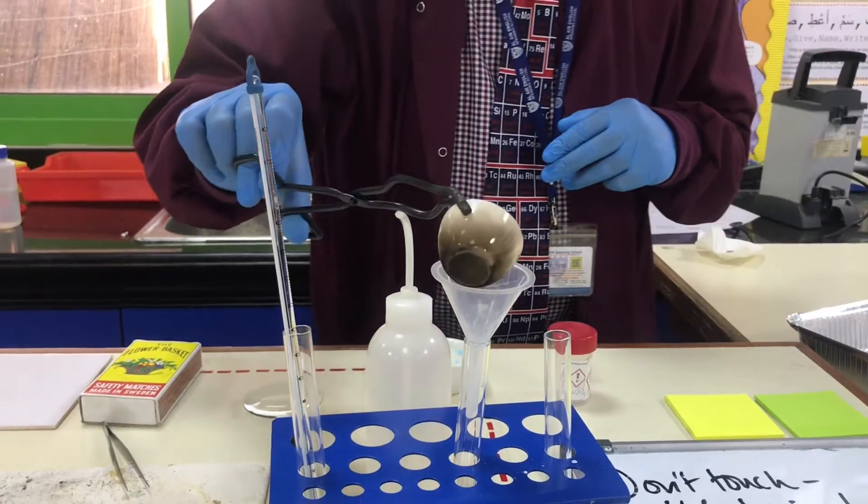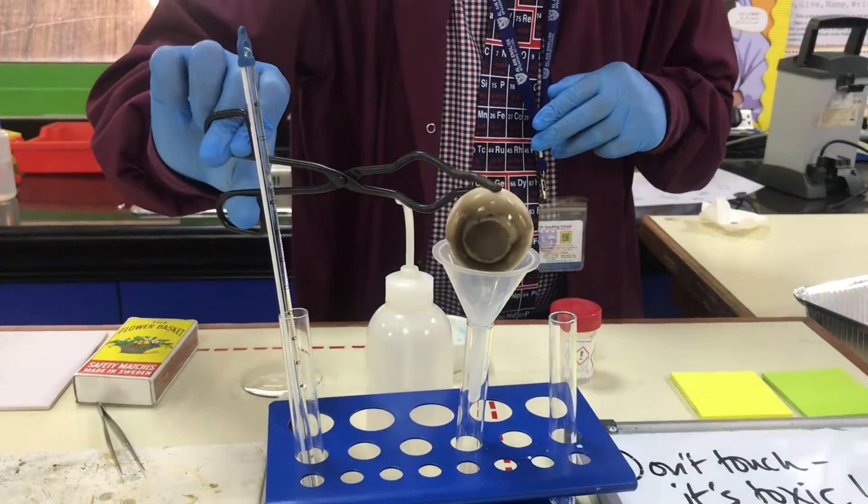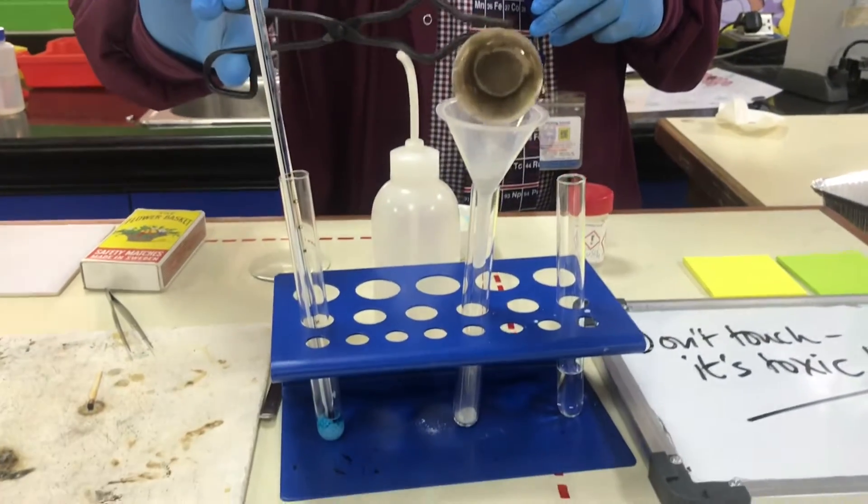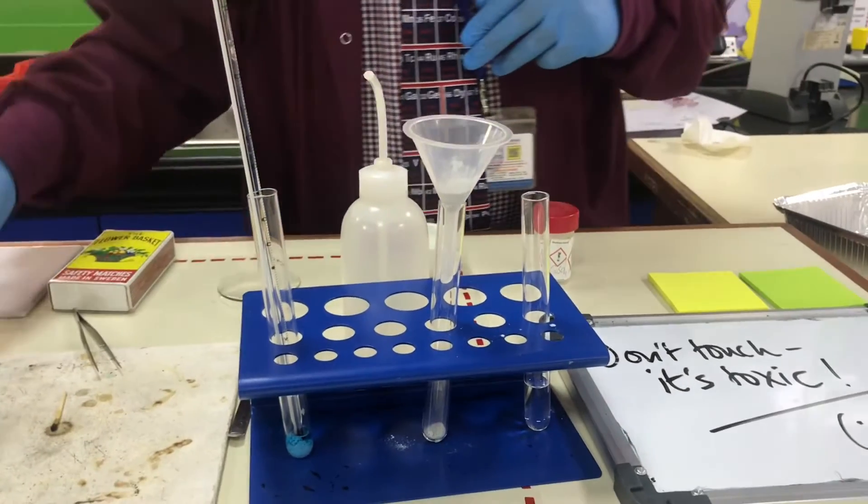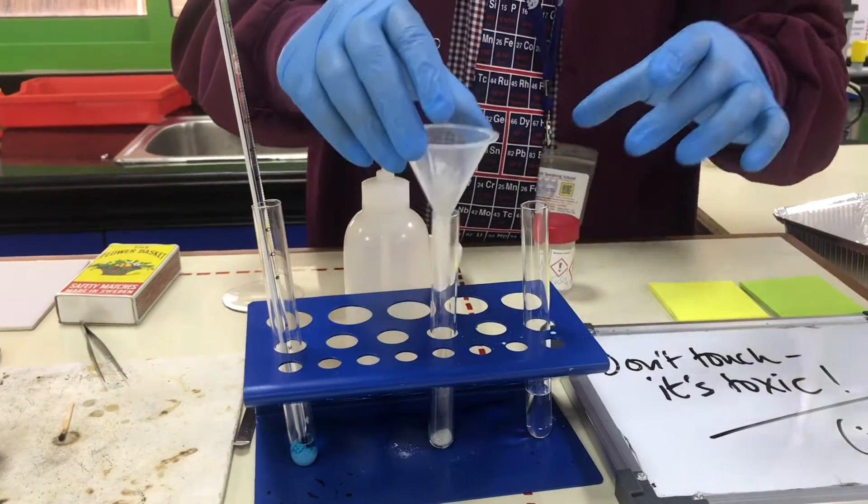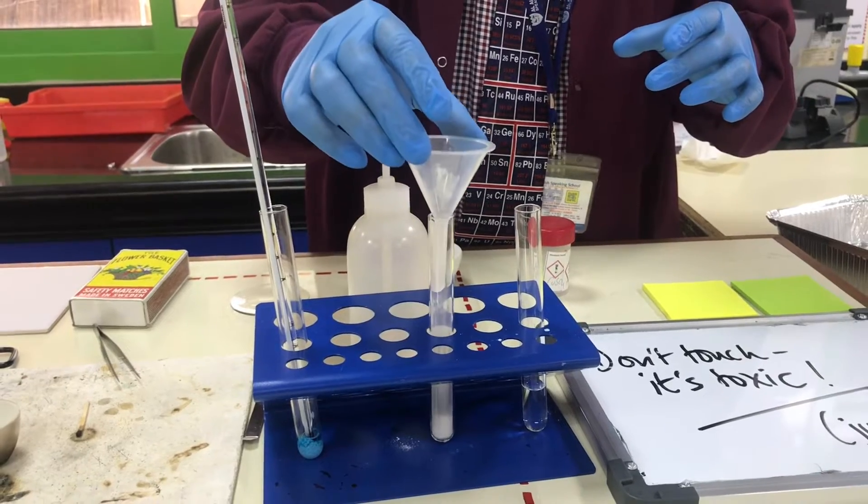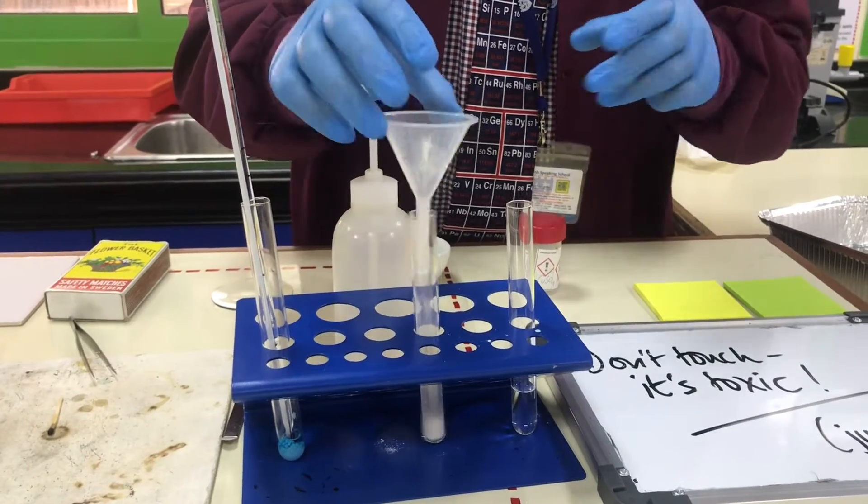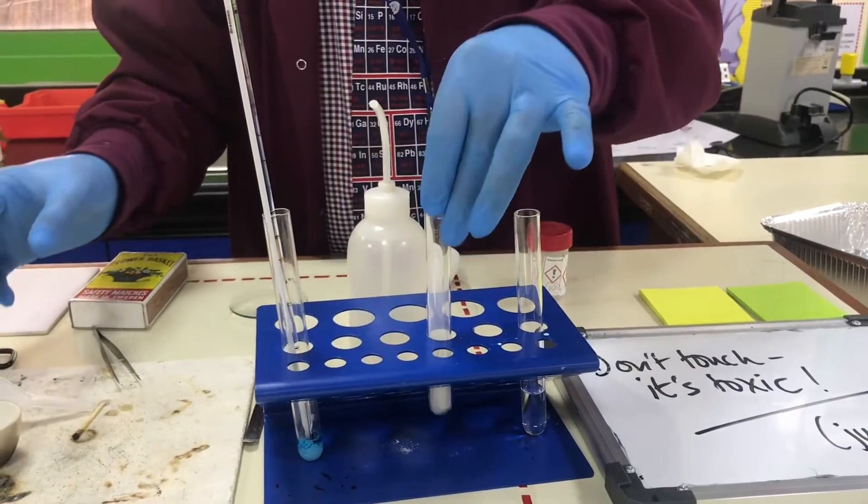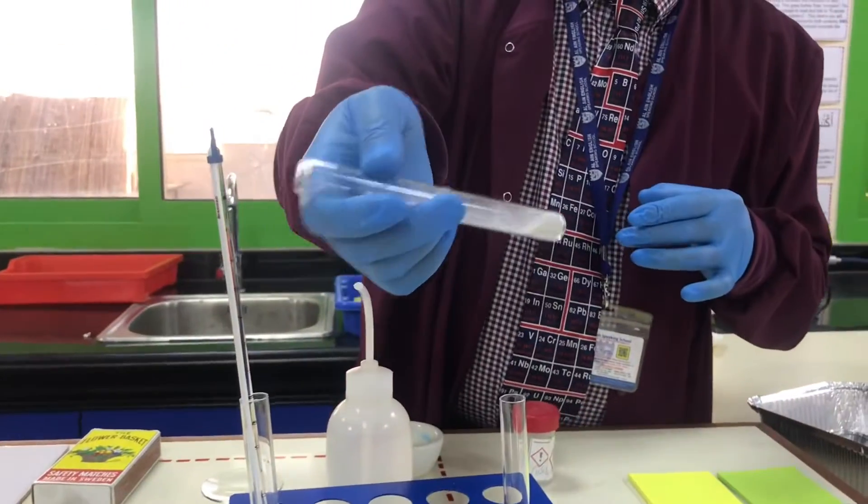Okay, so I'm going to use a funnel just to transfer this over to an empty test tube. Now during this process what's also going to happen is that this powder is going to cool down quite nicely. That's settled all the way in. So we're just going to leave that for a couple of minutes.